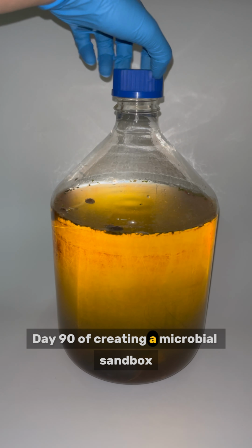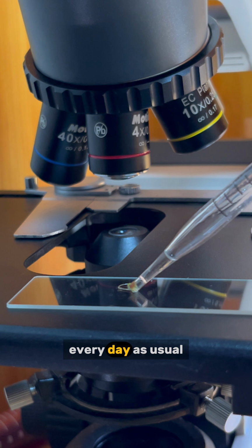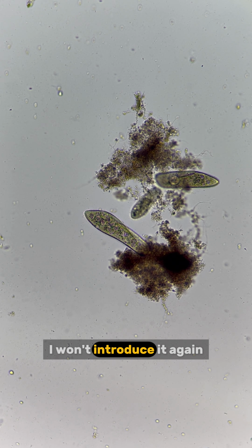Day 90 of creating a microbial sandbox by adding random stuff and observing it under the microscope every day. As usual, I will look at both the bottom and the surface of the sandbox at the same time. Our old friend paramecia again. I won't introduce it again.